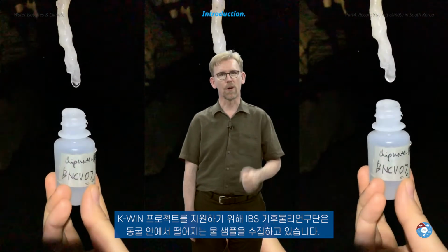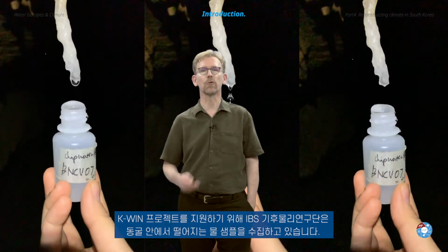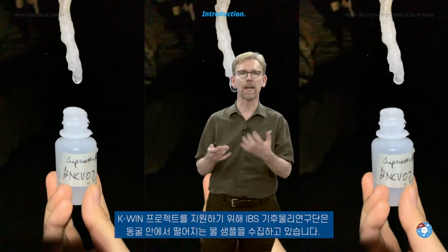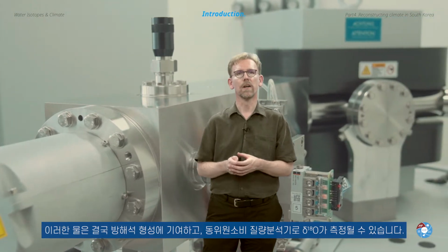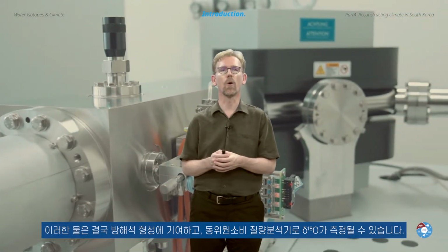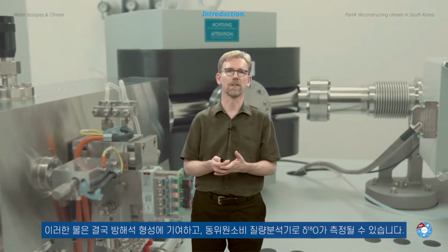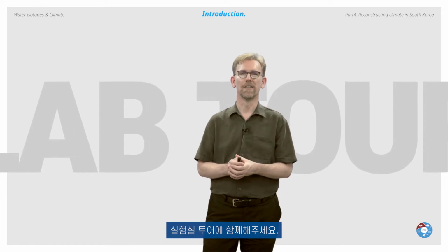To support our KWIN project, our ICCP team is also collecting drip water samples from inside several caves. Eventually, calcite is formed and we measure the delta 18O using our isotope ratio mass spectrometer. Please join me now on our lab tour.